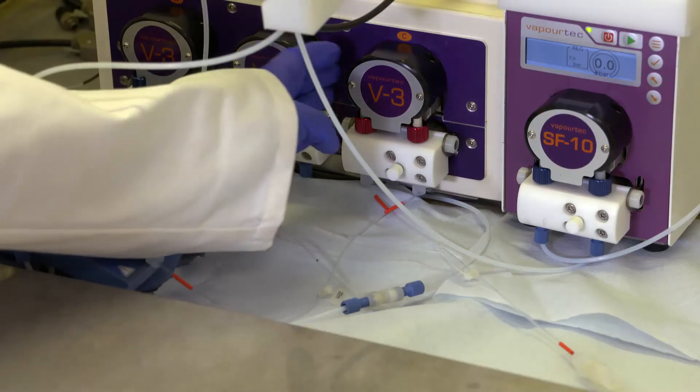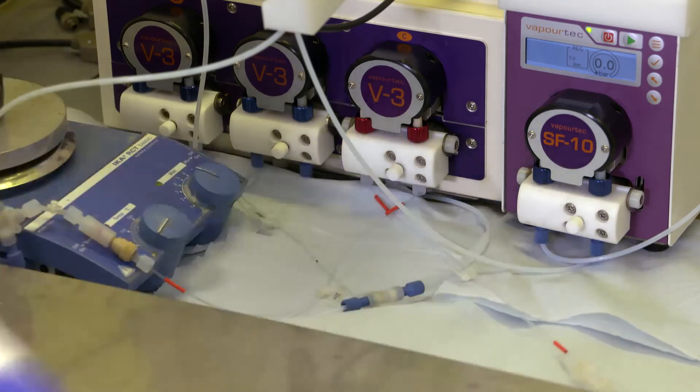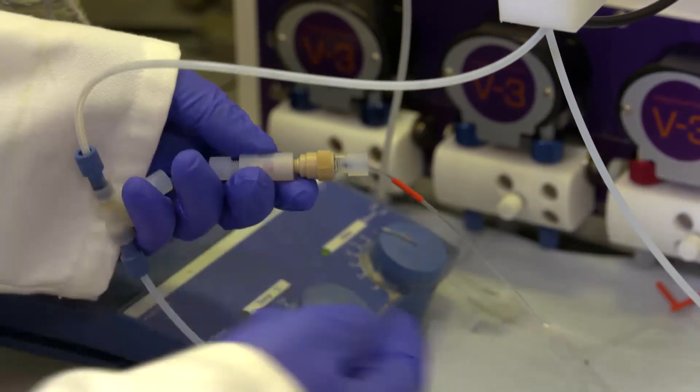The E-Series is equipped with the patented V3 peristaltic pumps. This is able to pump the gas directly from the inlet line without the need for any mass flow controls. To prevent any backflow I have a check valve between the system and the pump.